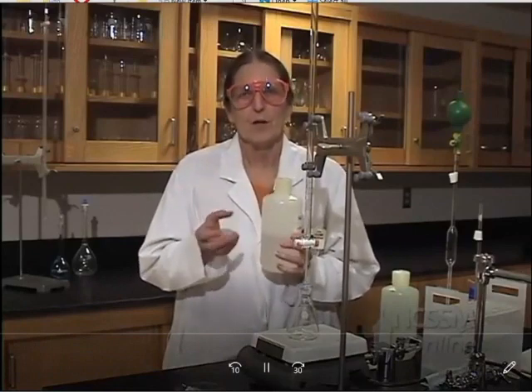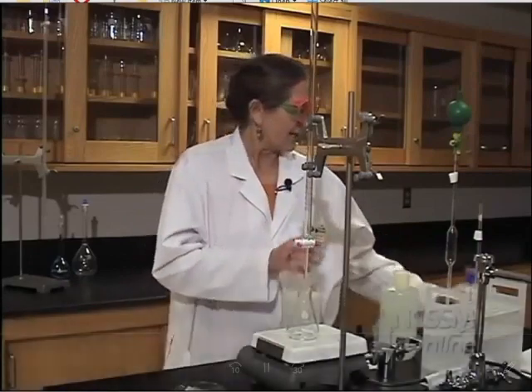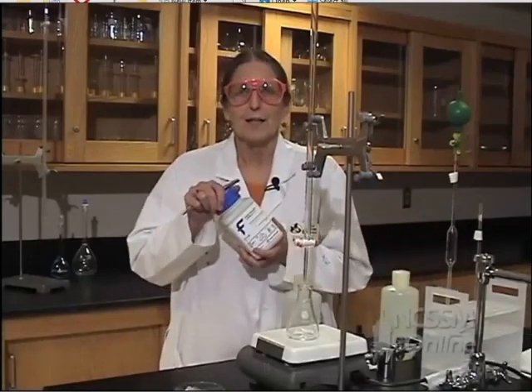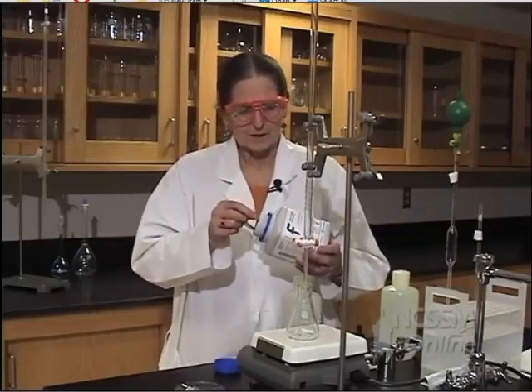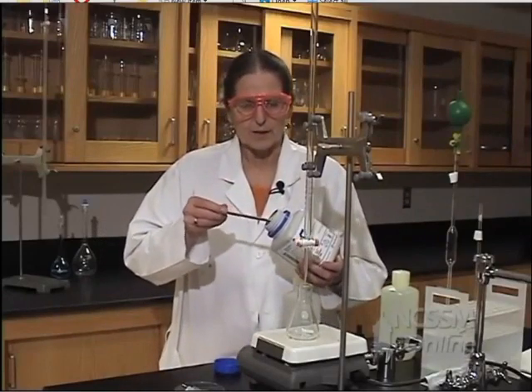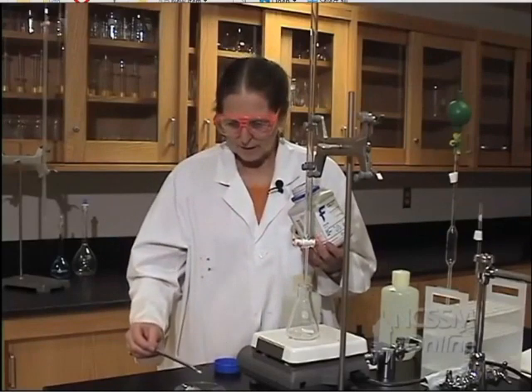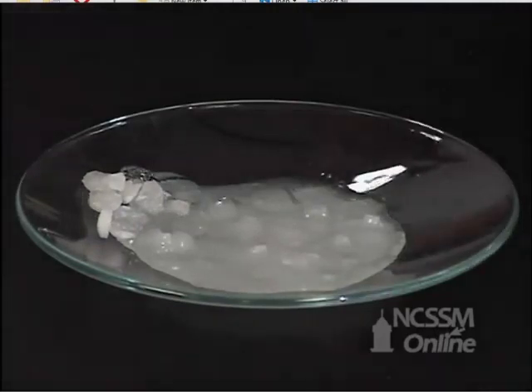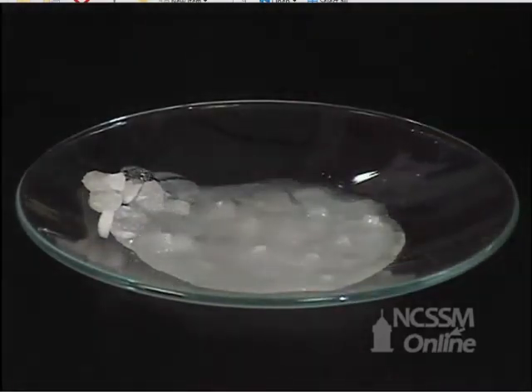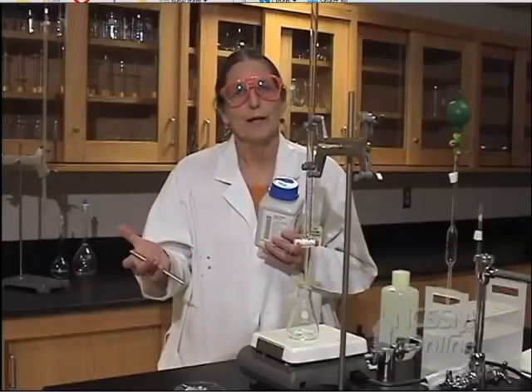Some compounds are very hygroscopic, and they'll absorb moisture from the air. For example, sodium hydroxide is very hygroscopic. When we take a sample out of a closed container, it's a nice solid tablet. But when we put it on the balance and wait a few minutes, it's going to absorb moisture from the air and thereby changing the mass. So our mass is not going to be a true mass.